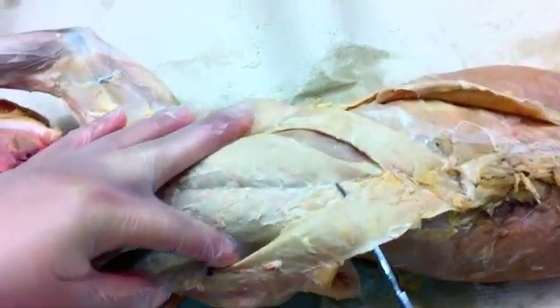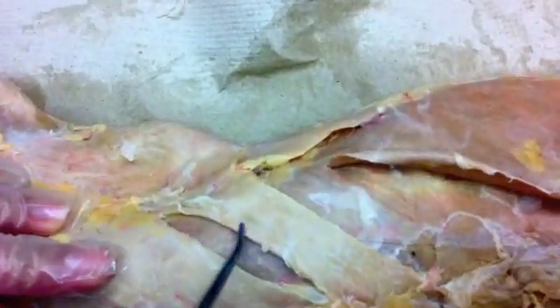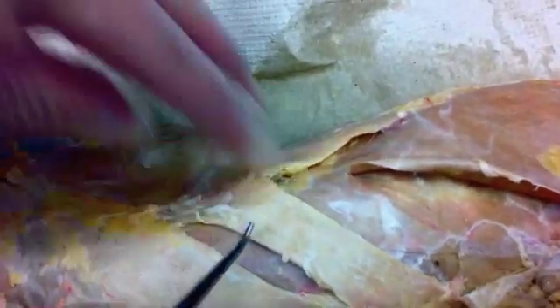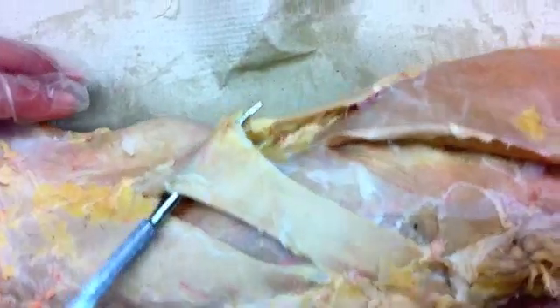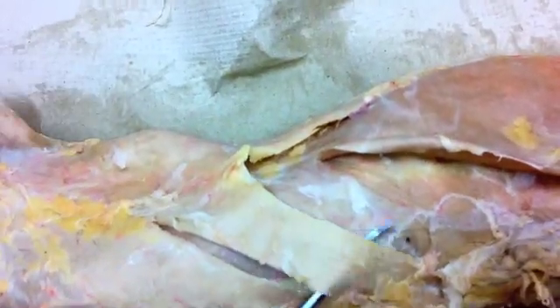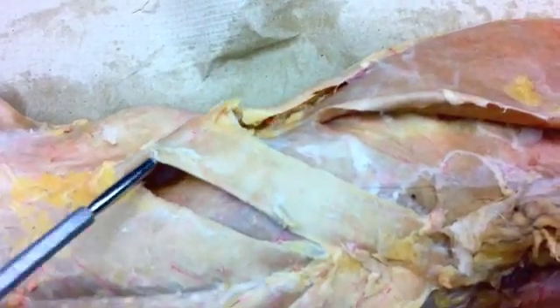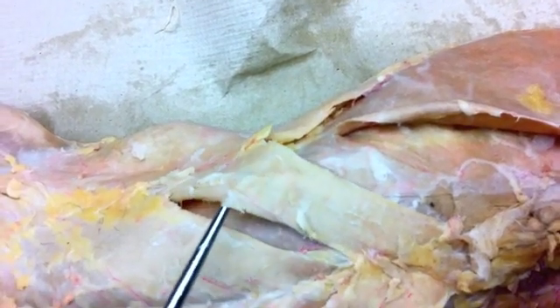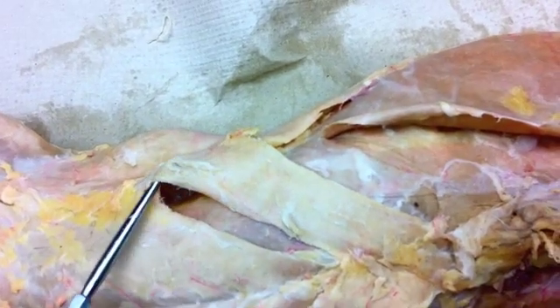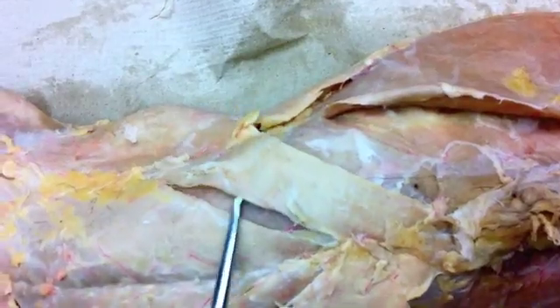We can see another xiphihumeralis on the other side of the cat, dissected out very nicely and being shown right now. These muscles run under the latissimus dorsi on their way to the humerus.